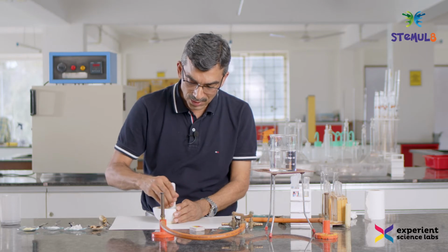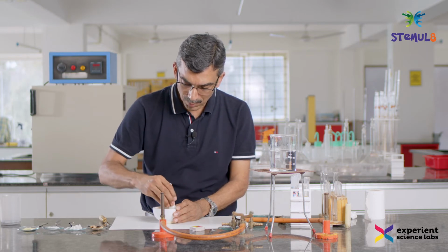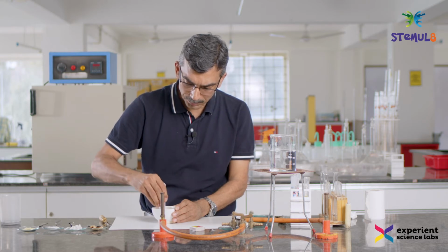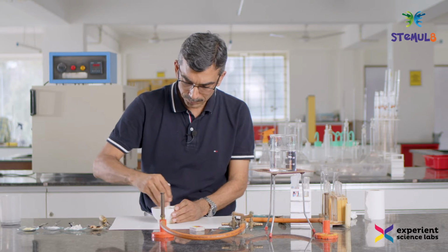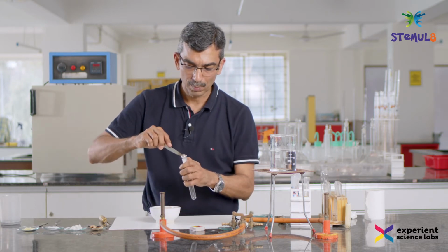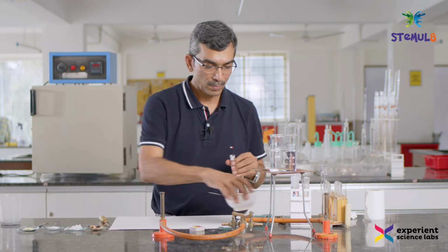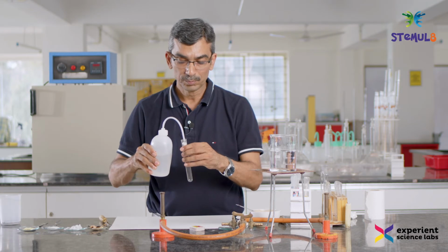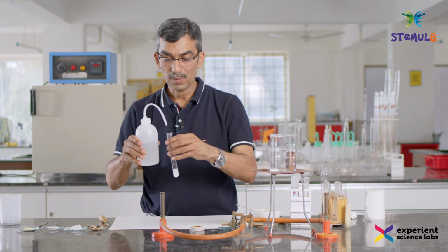I'm just smashing it up. The paste is what I am interested in. A bit of water will help it to go down. Okay, that's good.